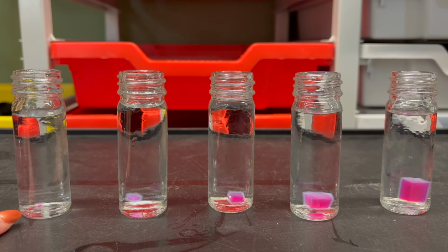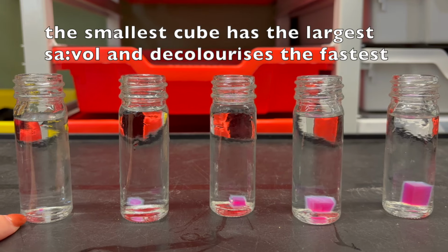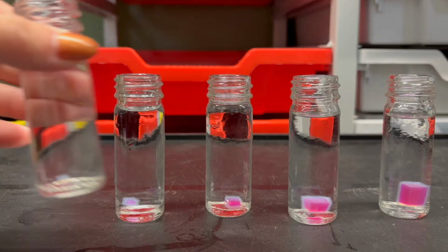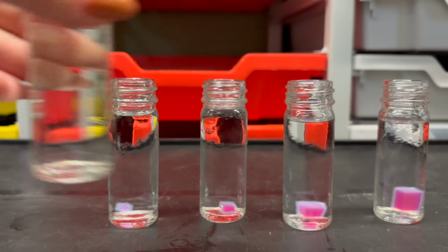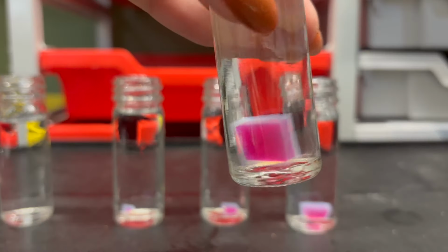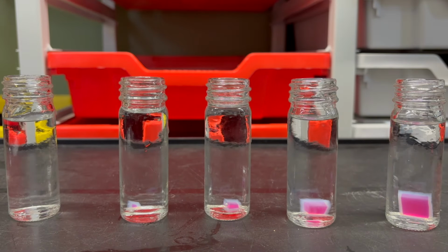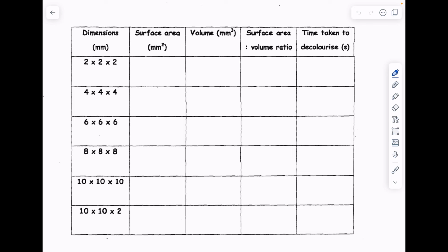As we can see, look, this is almost decolorized, showing how very quick the hydrochloric acid is soaking into the jelly. This one's taking much longer because it has a much smaller surface area to volume ratio. Look, it's basically decolorized. We compare it with this one, much slower process. So this really proves why diffusion is far too slow in large organisms which have much smaller surface area to volume ratios. Let's just do some maths to back up our findings.